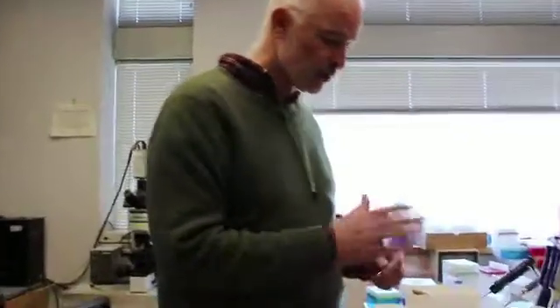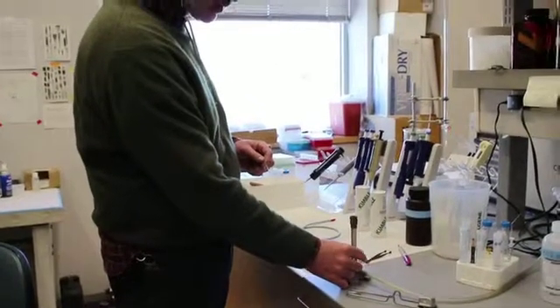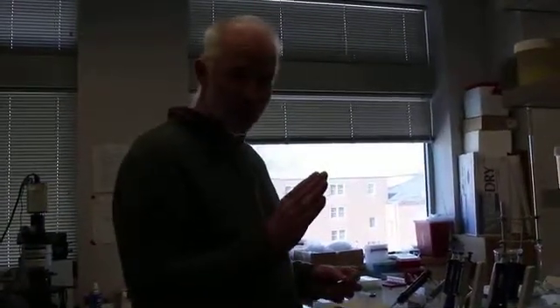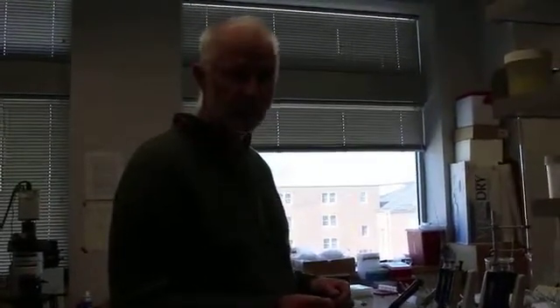First thing you have to do is get your Bunsen burner, nice hot flame with a nice well-defined cone at the top. And the other thing you have to do is be very zen-like. You gotta be quiet, you gotta focus, no distractions, because if you screw it up, you wreck the capillary, which isn't a big deal, but it's a waste of time.